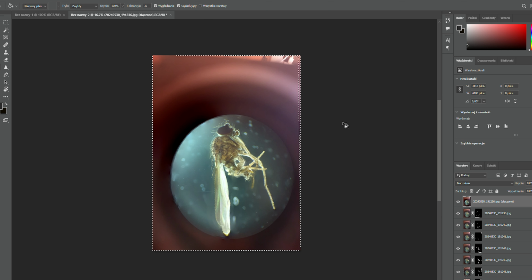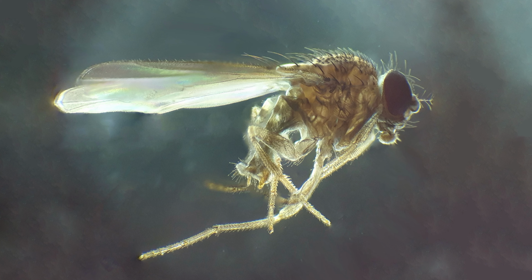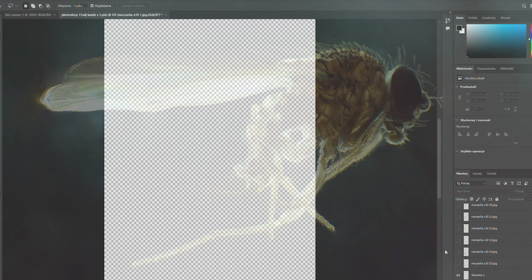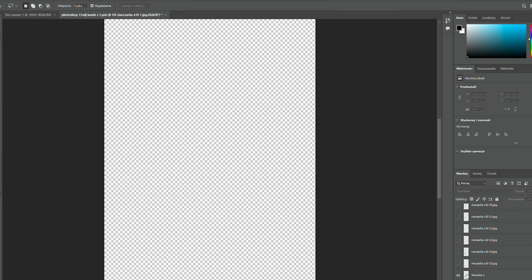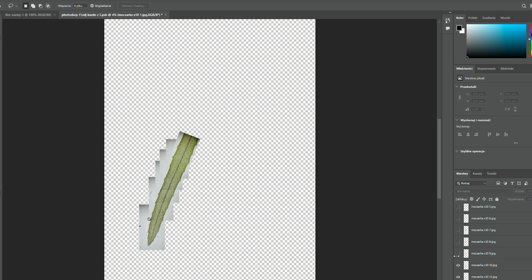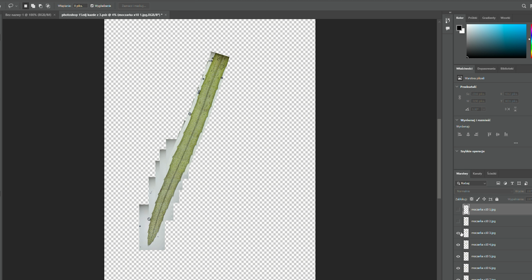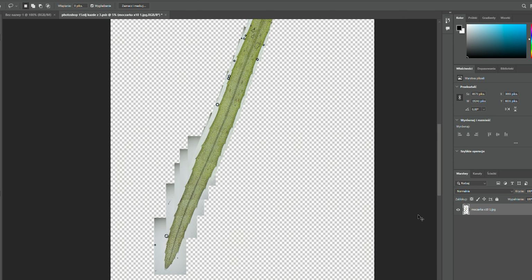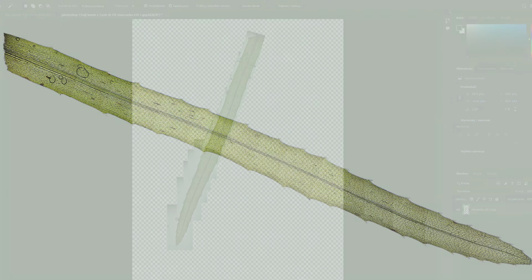On the right, in the Layers panel, you can see which parts were chosen as the sharpest and used to build the final photo. The result isn't as precise as in Helicon Focus, but for basic tasks, it's more than enough. For example, in this fly photo, you can see some small shifts near the wing and tiny hairs on the head. Photoshop is also great when you want to combine several photos of a larger object that doesn't fit in the frame. You can photograph individual sections, enhance each with focus stacking, and then merge them into one large image. After a few touch-ups, like background cleanup or replacement, you'll end up with a complete image of your subject.